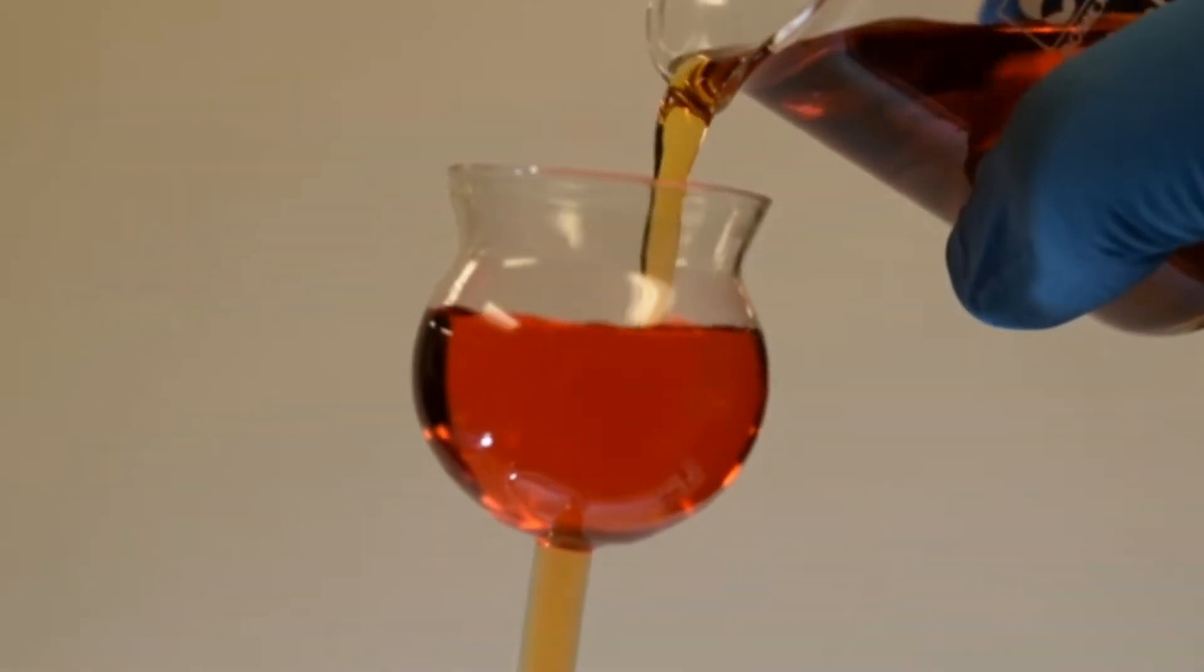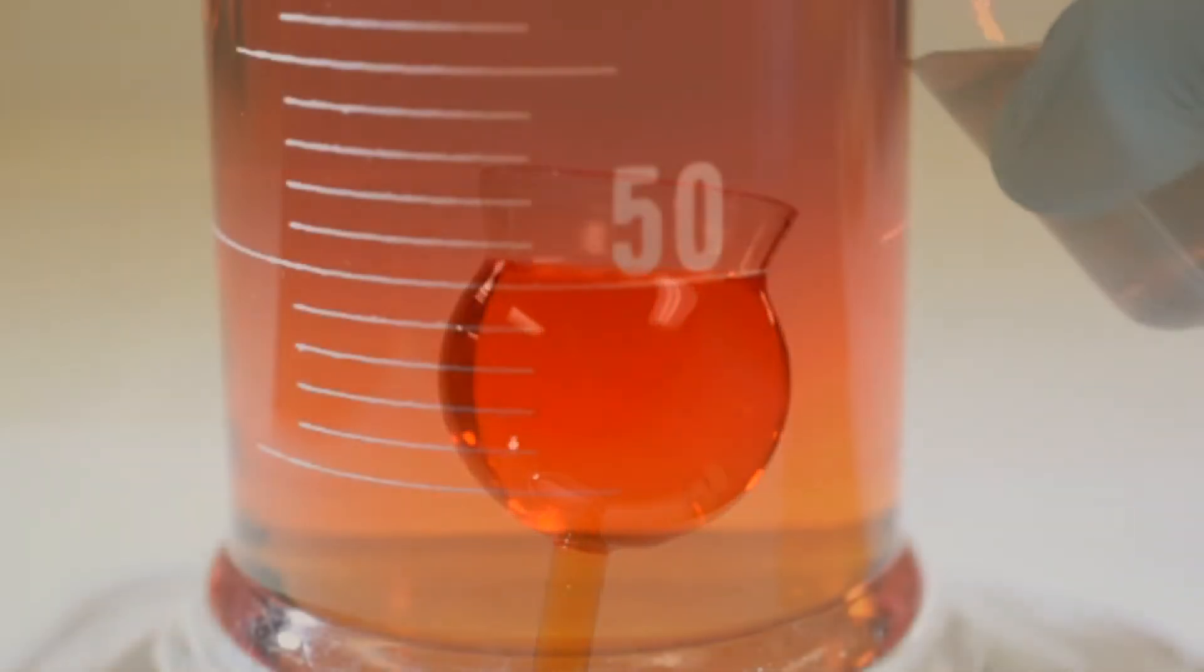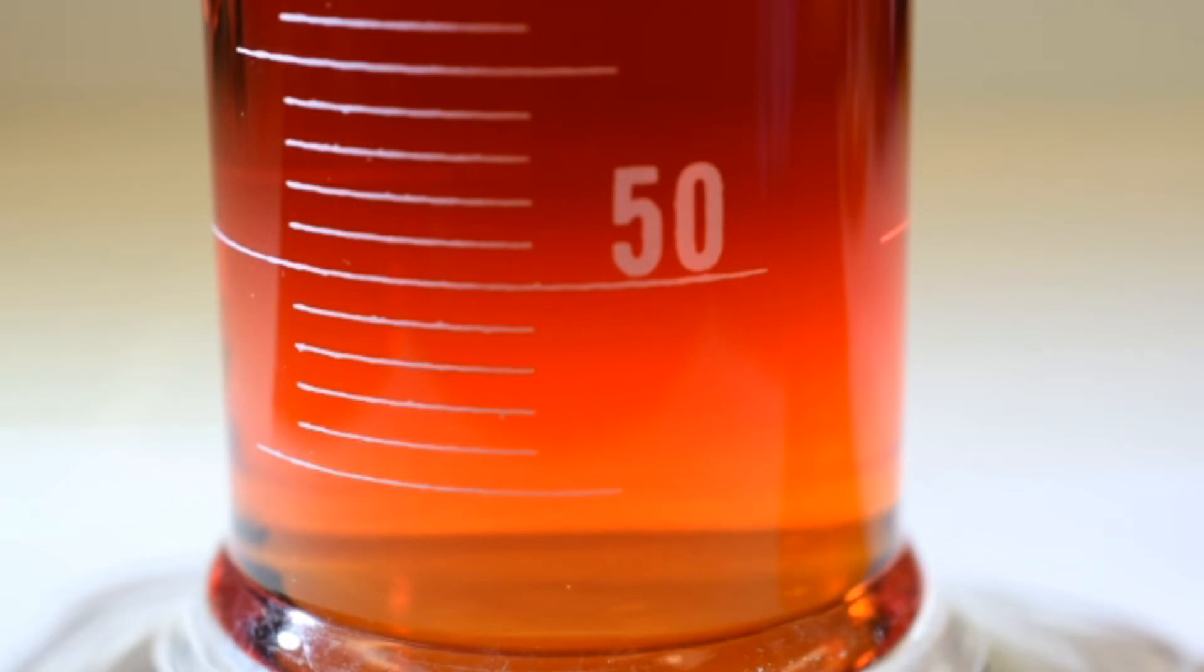Follow the same procedure for the remaining solutions. And here you see the orange solution beginning to displace the red solution.